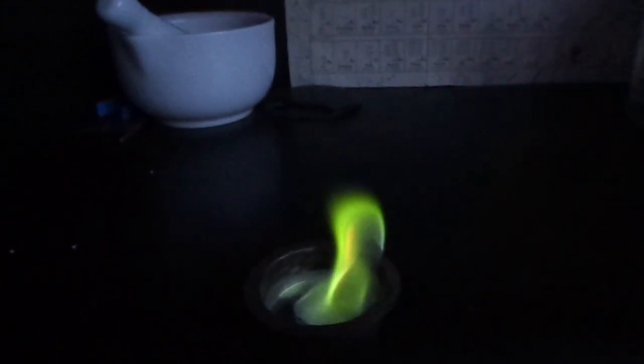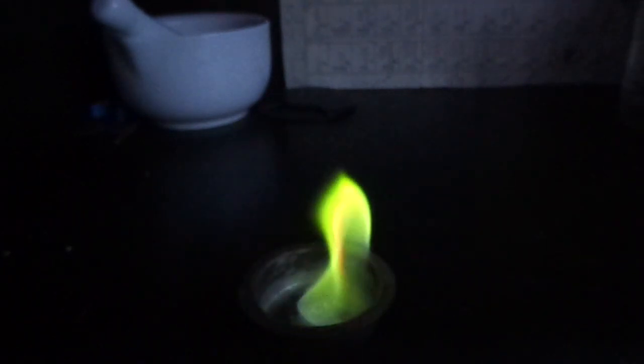Okay, let's burn it. As you can see, it gives a very nice green flame.